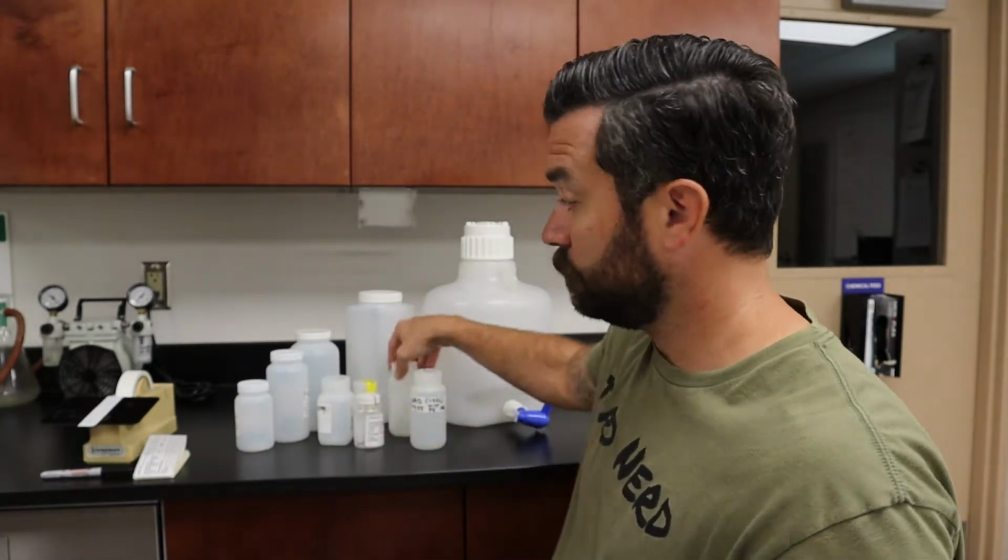Make sure you are labeling your bottles, okay? Labeling with what it is, the date, your initials, where you got it from, how much it was, and what test you need ran on it is very important. Making sure that you have those labels on there is going to benefit you and protect you from missing out on your samples. Now, you could do like we do.